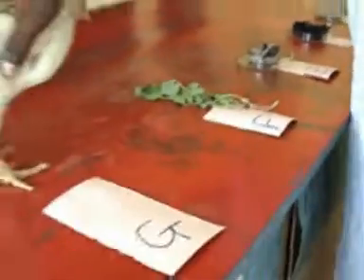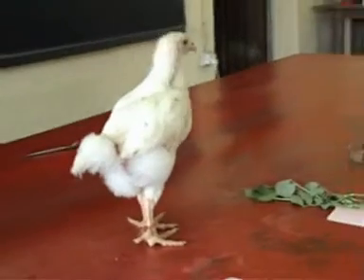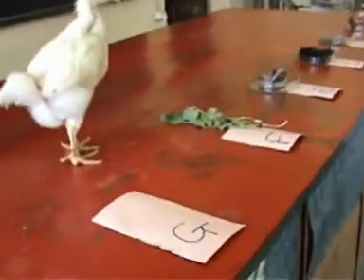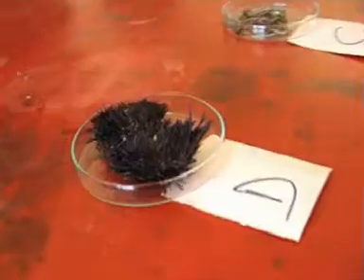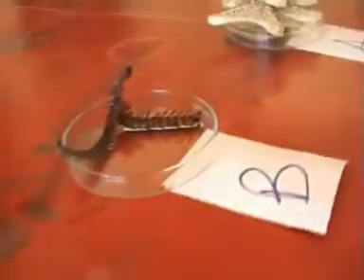We have organisms A, B, C, D, E, F, and G placed before the candidates. This is usually question one for biology practicals. What is required of candidates is that they leave their seats with their question paper, come up to the table — called a walking post — observe these organisms, and first of all identify the names of these organisms.